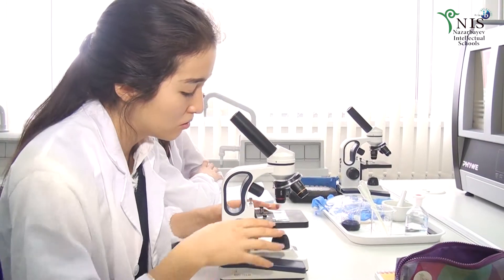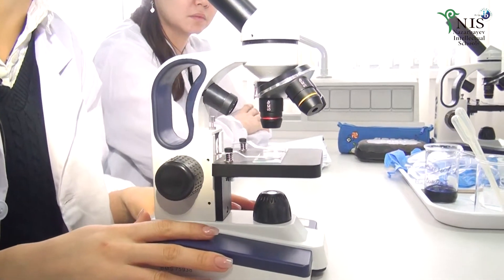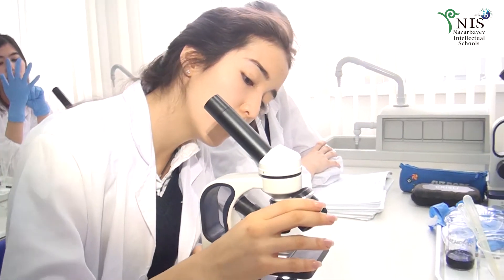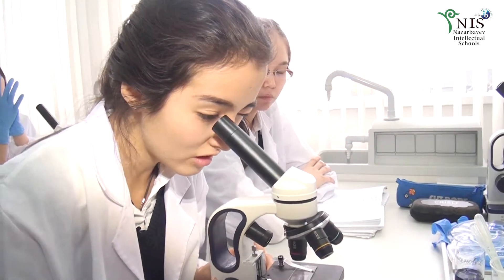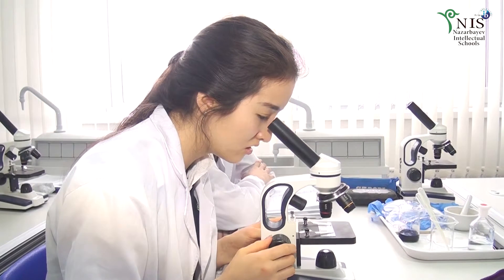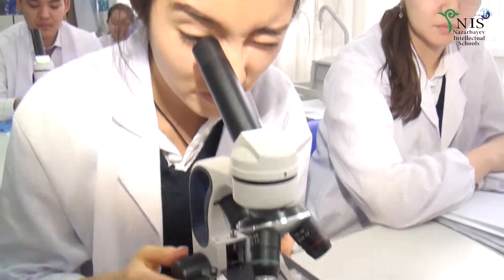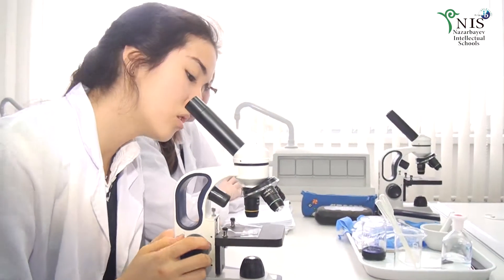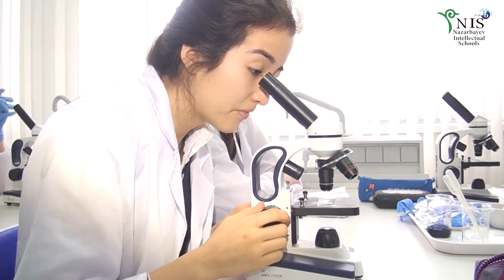We should check that the material is placed correctly. Then we select the required magnification. We start with the smallest magnification — for this microscope it's 4. Then try to set the height of the stage to make the material visible. If it's not clearly seen, change to the next one: 10. Then try to set it up again. If the material is still not very clear, choose another magnification. As soon as the ocular is chosen, we can start investigating the object. After the work, turn off the microscope and place it back in the same place.